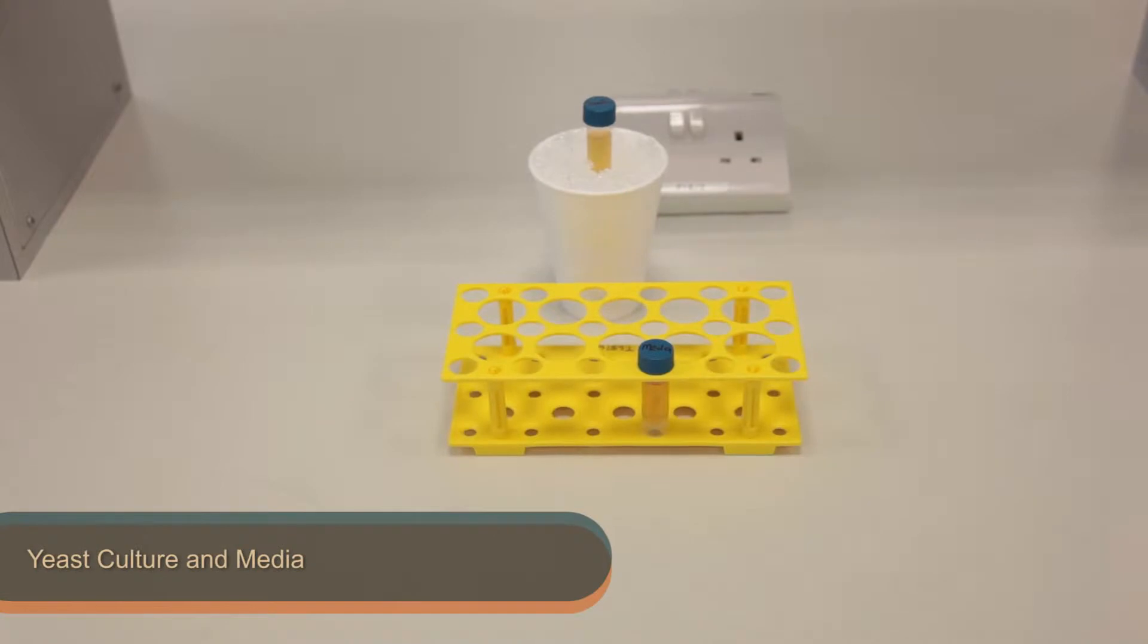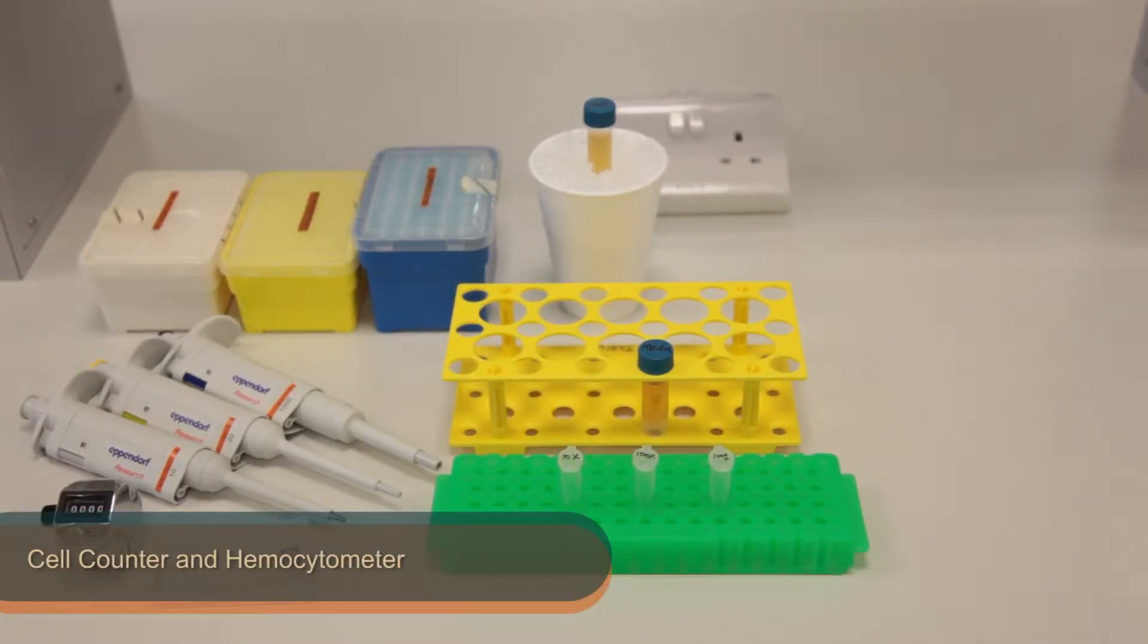These are the reagents and equipment needed. Do check if you have everything before you start.